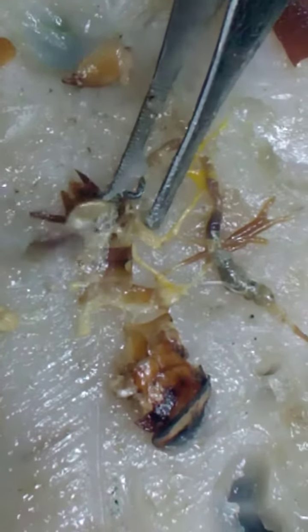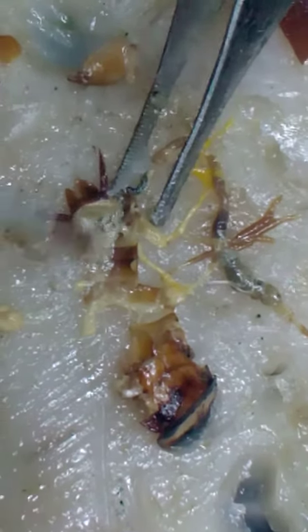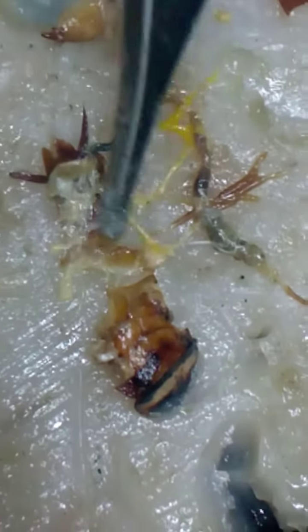What is this? Rectum. Okay, so this is a cockroach. Let's go.